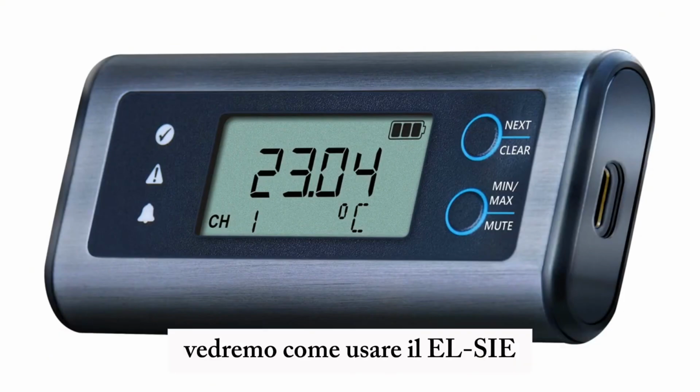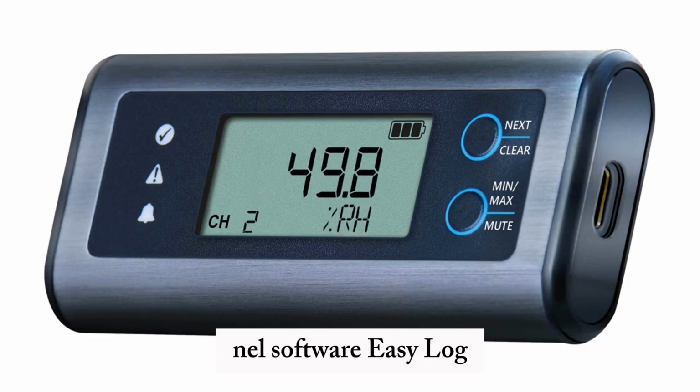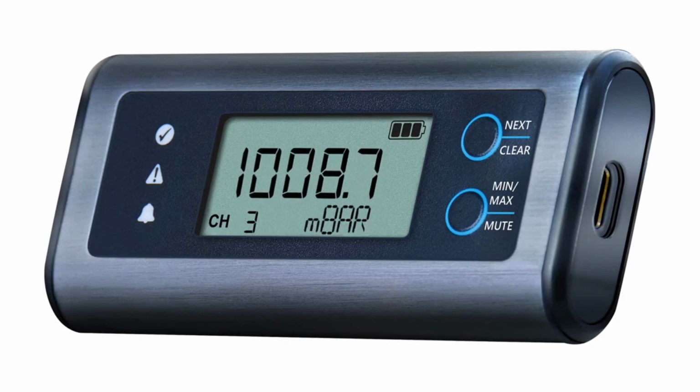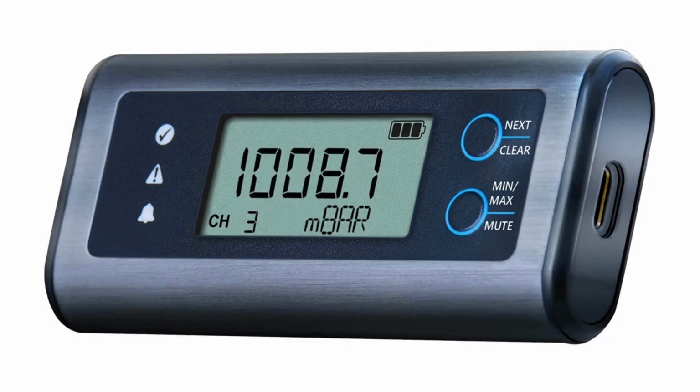In this tutorial we'll be looking into how to use the EL-SIE once we've set all our parameter thresholds in the EasyLog software. In this video we'll be looking into how to move between the different channels and how to move between the minimum and maximum readings. We'll also be looking into the alarms and what they look like in the EL-SIE screen.